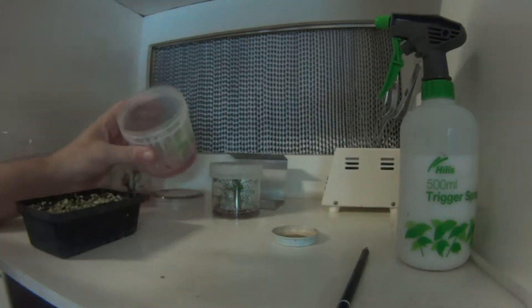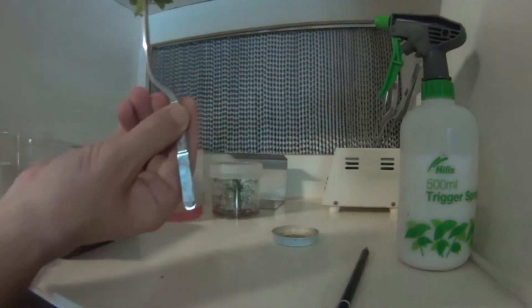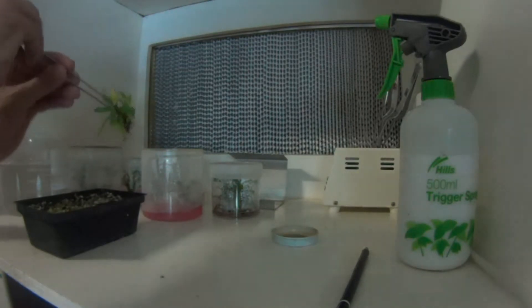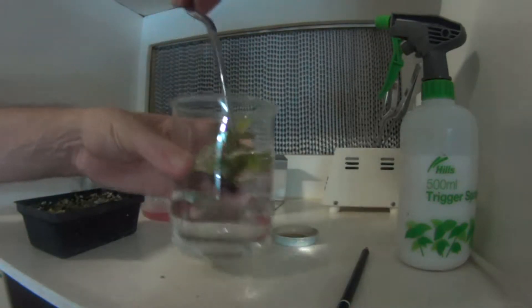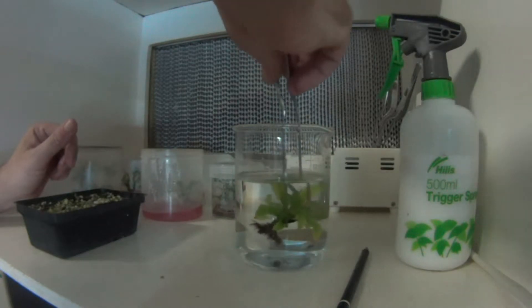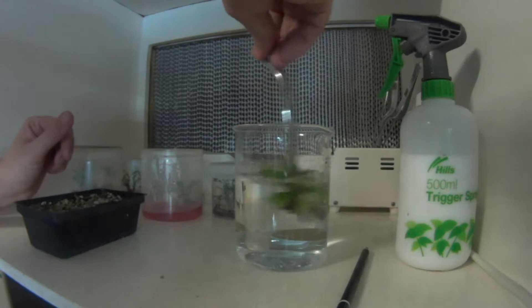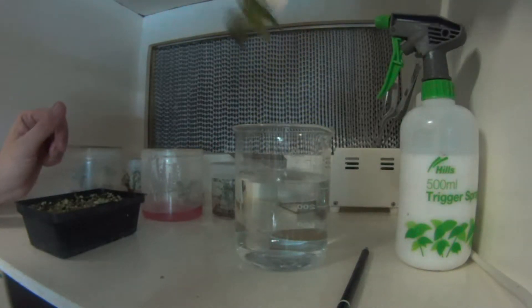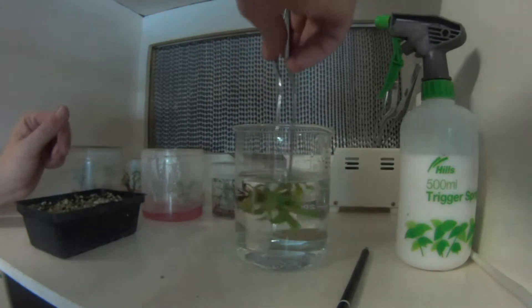All I'll do is simply remove my plant from the media. You see there's still a bit of gel on the bottom of it, so give it a wash in the water. You can do this under a running tap which would work probably better, but for the purpose of the exercise today I'll just simply give it a good soak in some water. I removed all the gel from the plant. Looks pretty good.